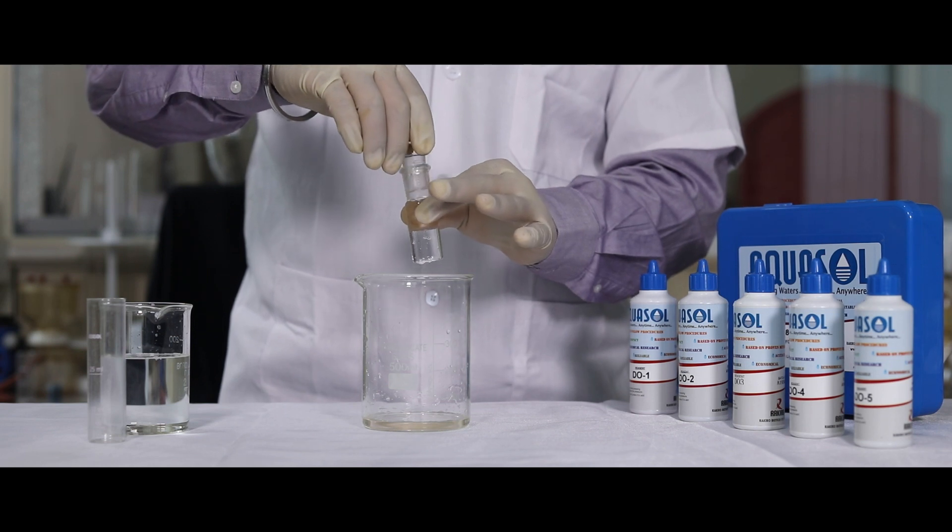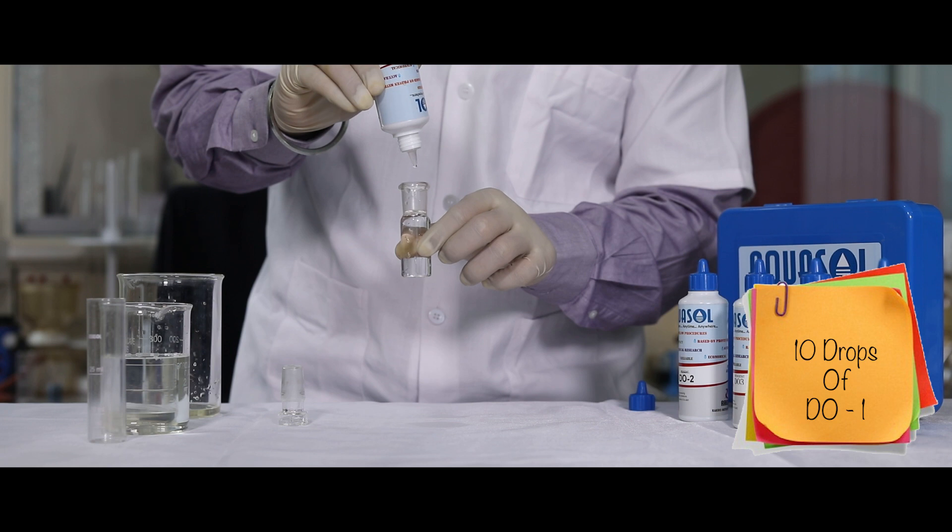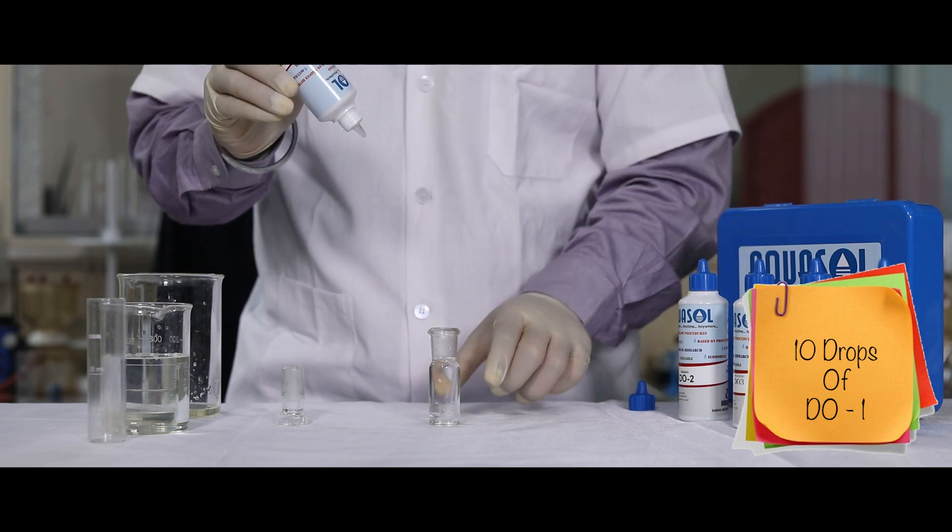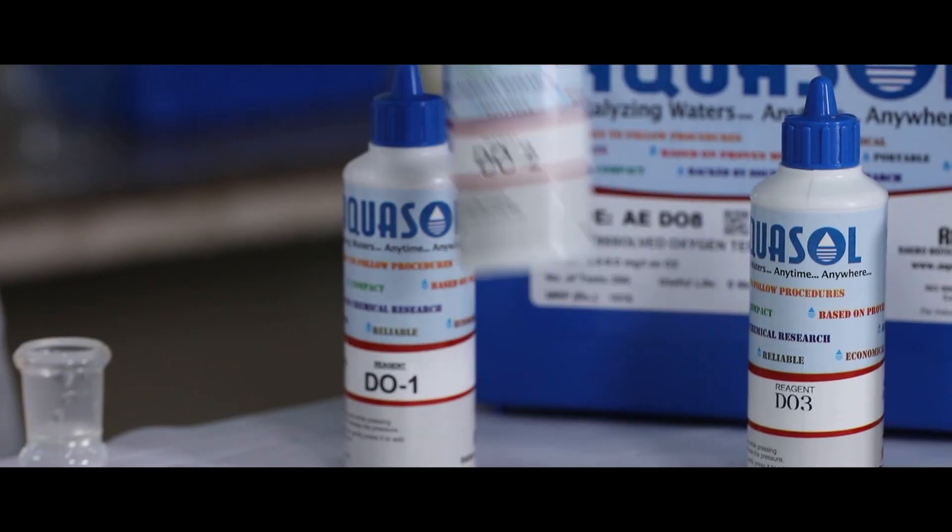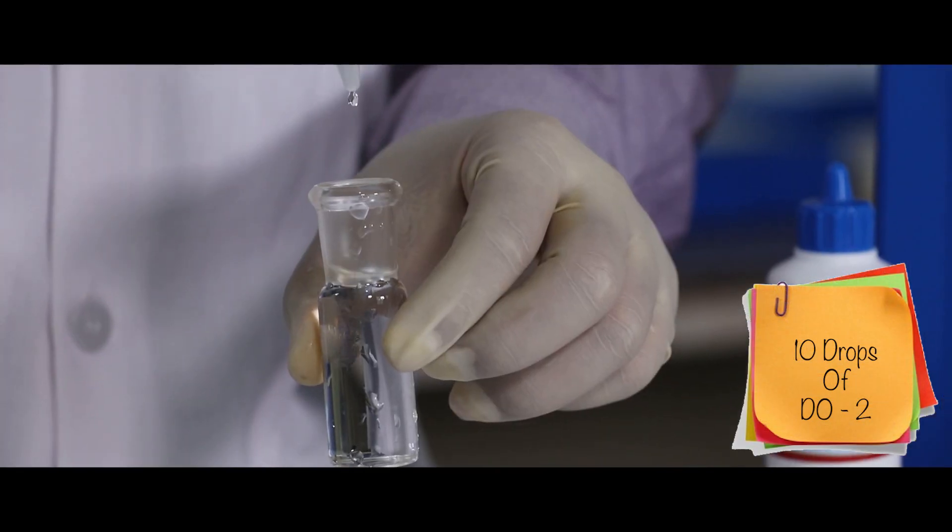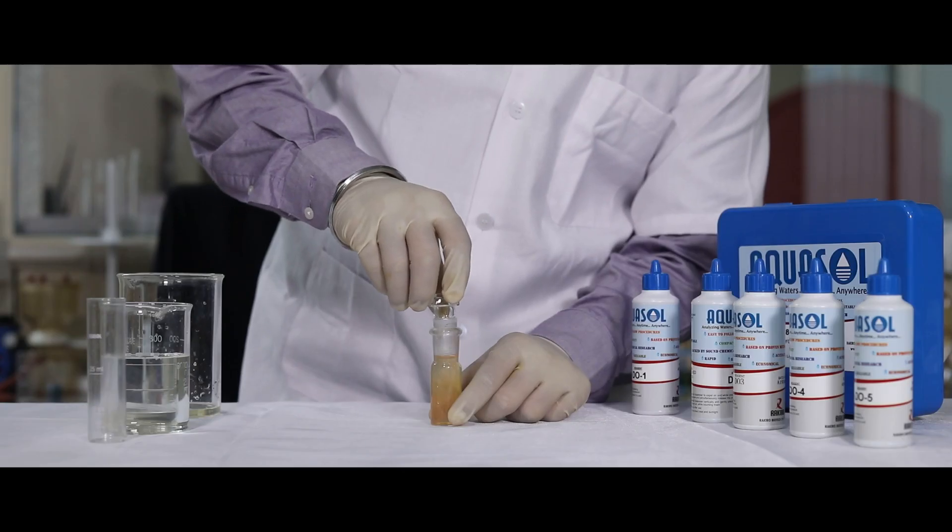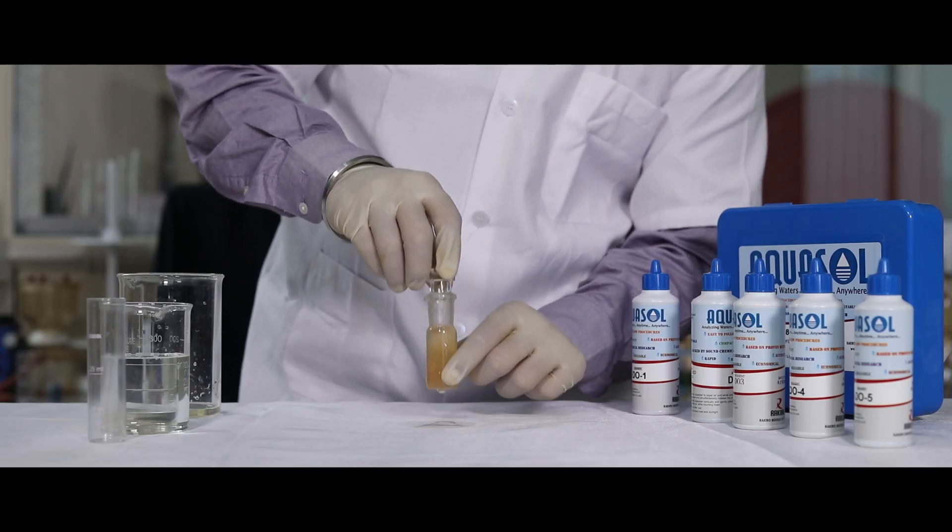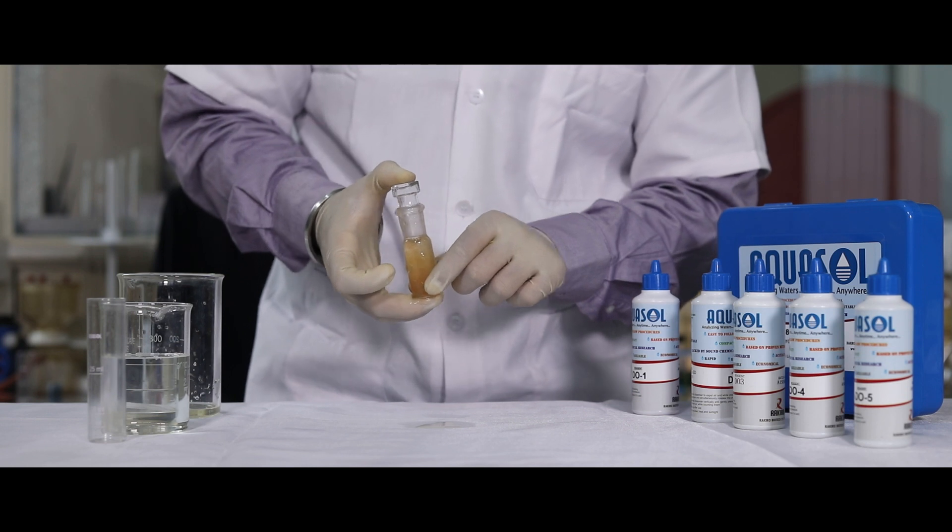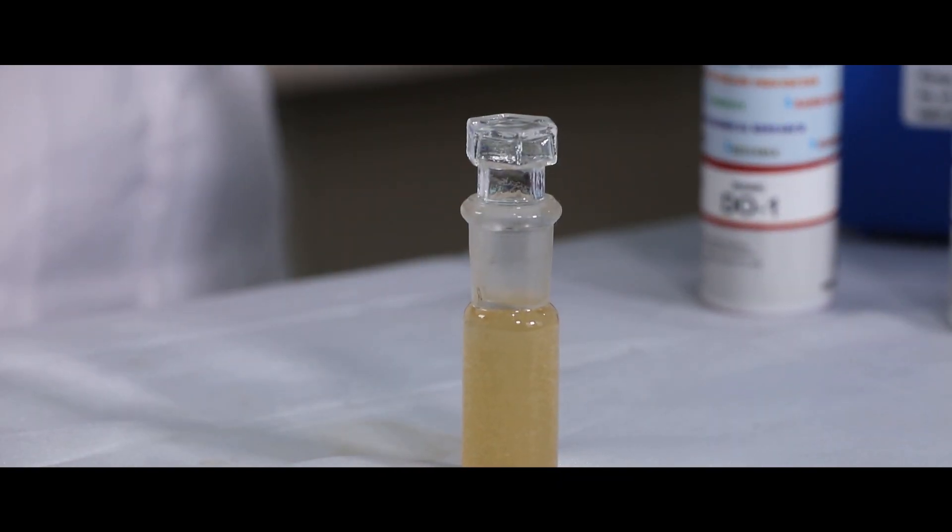Now remove the stopper and add 10 drops of DO1 reagent followed by 10 drops of DO2 reagent. Place the stopper back again and mix well. Allow it to stand for 20 minutes.